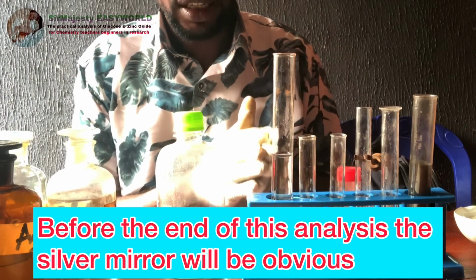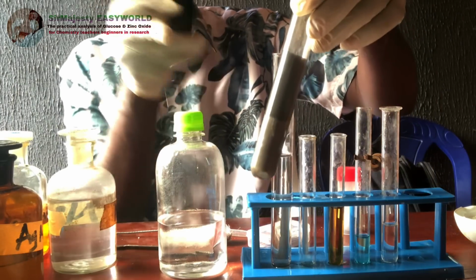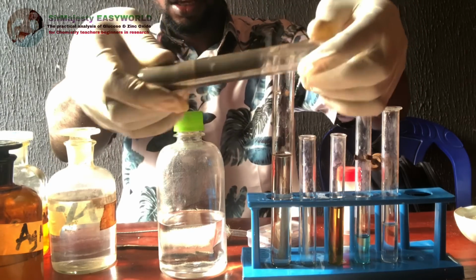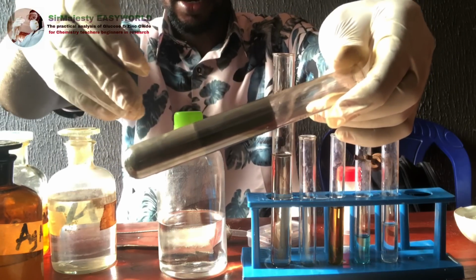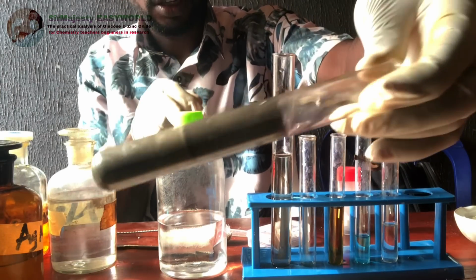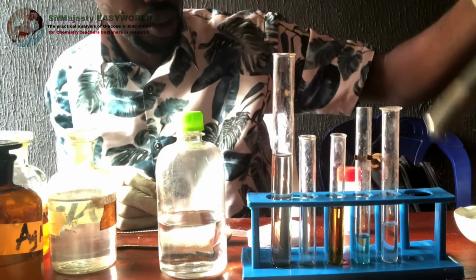Like I told you, it might take 30 minutes sometimes, but this is what it will look like. These two layers are all silver coated, only that I added more glucose to this just to make it more lovely. So if it stands now, after a while, if I add glucose again without shaking this, it will form two layers, but they are all silver mirror coated, and hence the name silver mirror test.